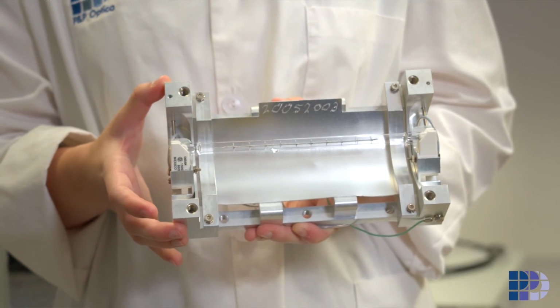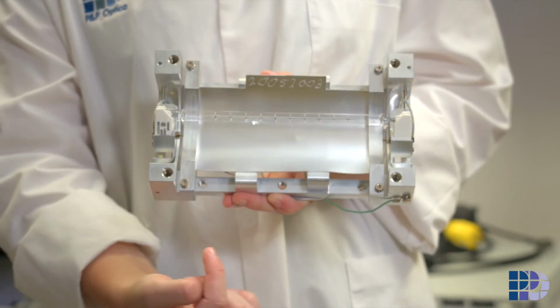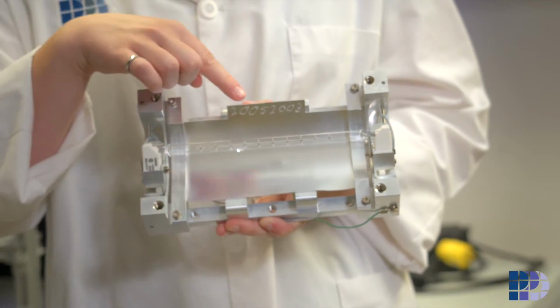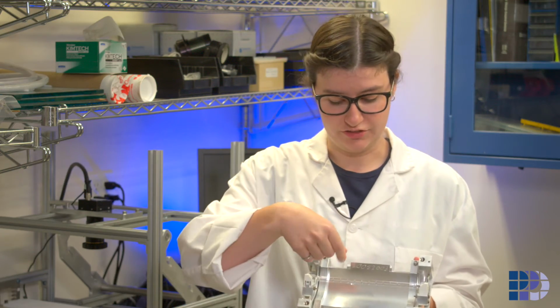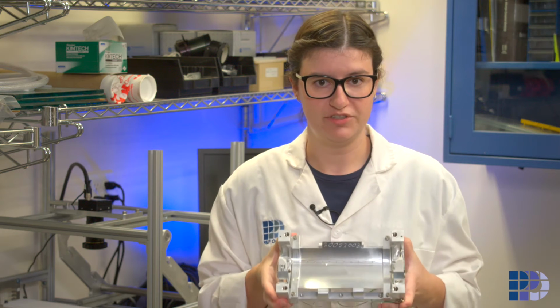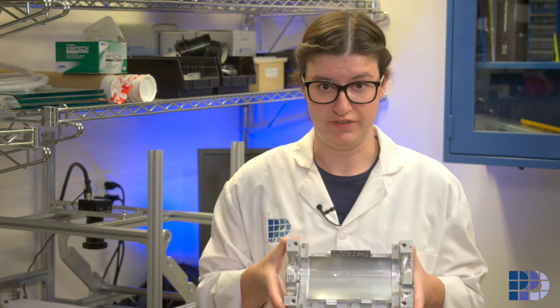But here you can clearly see both the reflector and the bulb. So the reflector shape was designed to allow for high alignment tolerances. And the bulb location is actually adjustable. So during lamp assembly, the bulbs are aligned so all lamps have identical lighting profiles.